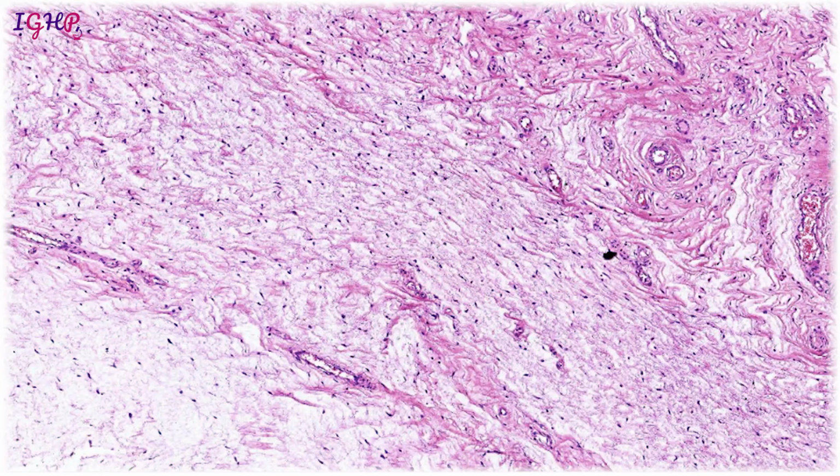So again, we said this kind of matrix where you see a lot of bluish and mucinous hue, we call it a mucomyxoid matrix that we see in the connective tissue stroma, and these are all the fibrocytes which are seen scattered in the stroma. In areas where you see mucomyxomatous change, the fibrocytes assume a different kind of shape, of which we'll be talking later, and instead of a spindle shape, they sometimes assume a stellate shape, or you can say a star shaped appearance, and then they're known as stellate shaped cells.